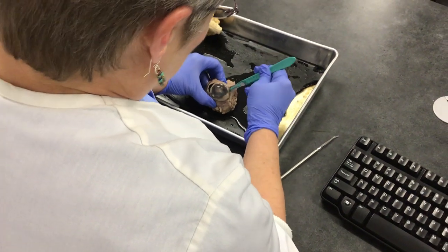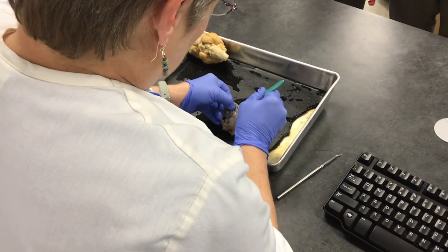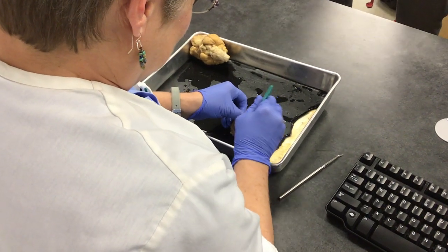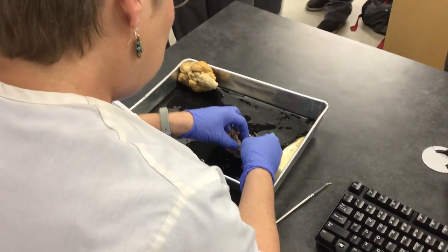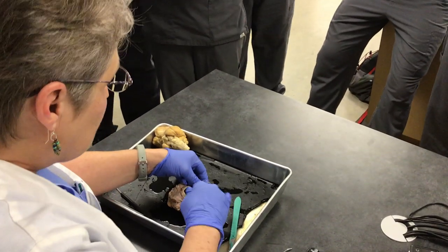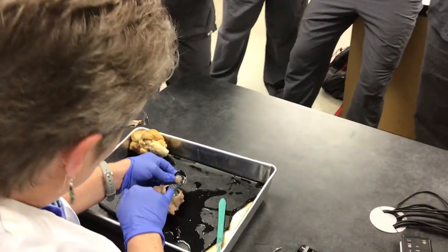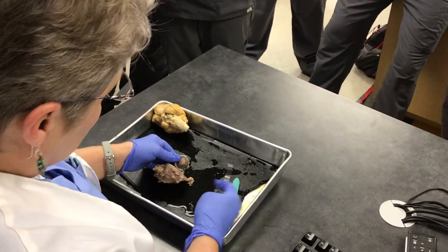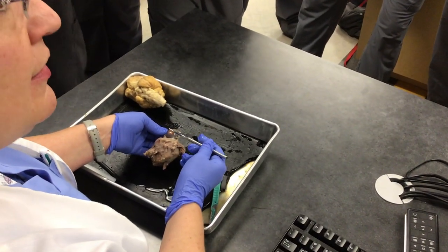So you're basically digging the eye out here? Yeah, so what we're doing — I'll show you. This part is the anterior chamber, and this would be the posterior chamber. The first thing I'm going to have you identify is right here — this is the cornea.